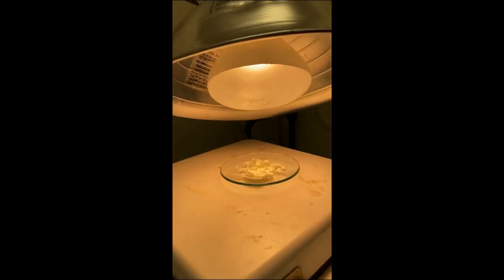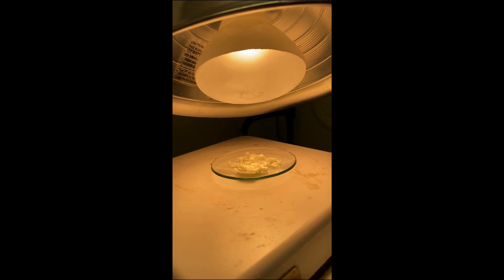So we're going to put this under the lamp until they look nice and dry. You can still see that looked a little wet there. You can see how it's all still kind of clammy and looks very wet, so we're going to leave it on here for a little bit.